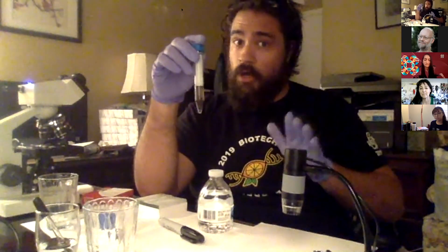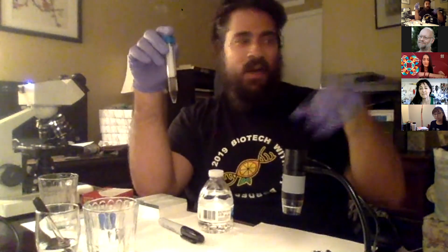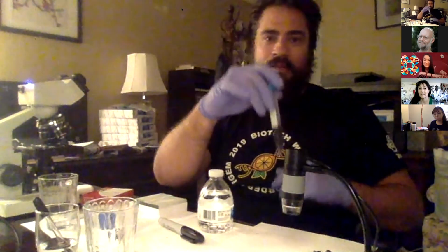We're gonna take our sample and we're gonna shake it back and forth. Not super hard. We don't want to centrifuge them out. Imagine if you were on a lazy river in a log, you wouldn't want to go down like Niagara Falls. You want maybe a jacuzzi tub action. So kind of go back and forth. 1 Mississippi, 2 Mississippi, 3 Mississippi, 4 Mississippi.